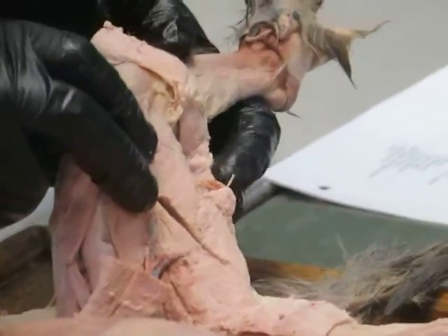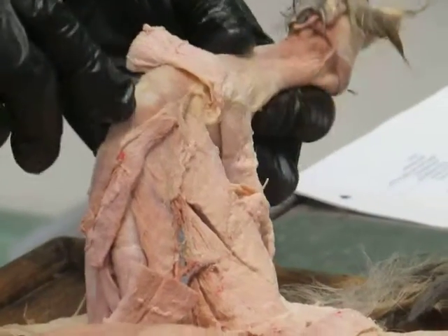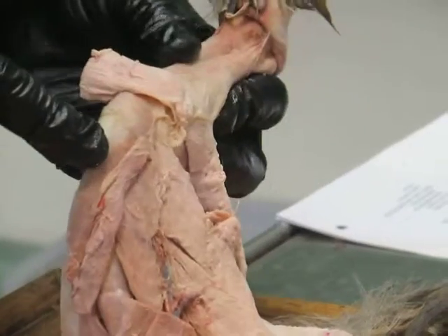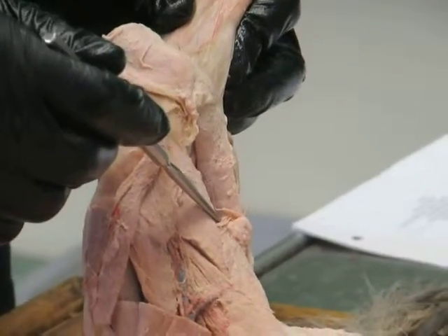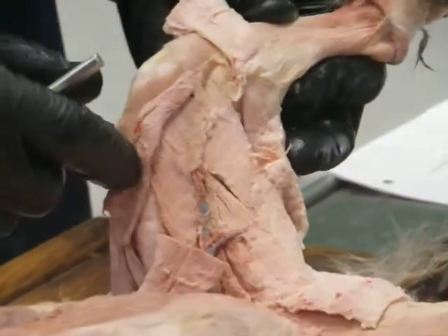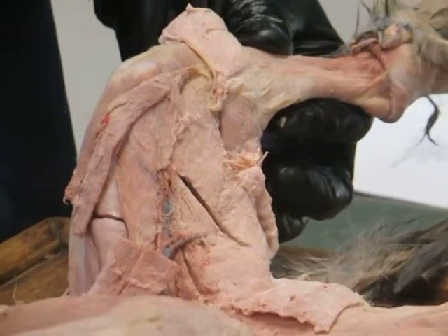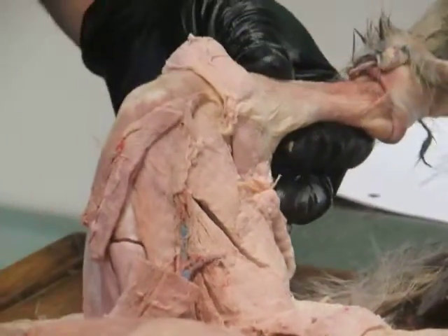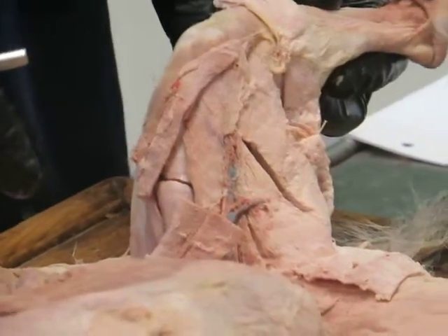Retract. Okay. One thing that's really good to know is when you've got an animal and you're playing with it, if you do something like here, I'm going to protract the thigh and extend the knee. Notice how these muscles get very tight. That tells you that what they do in life, the action, is the opposite of that. It's what's going to cause them to get loose, because if they get shorter, that's going to take up that slack that you see when they get loose. So anything that makes the muscle slack is actually the action that they have in life. Does that make sense? Okay. So you can play a little bit with your animal. The cats, for some reason, seem to be a little more flexible than the rabbits. I'm not sure why that is.